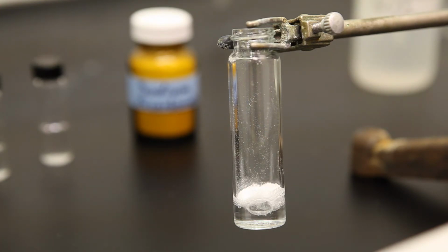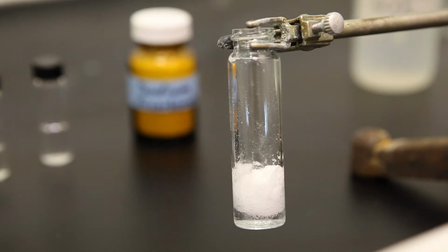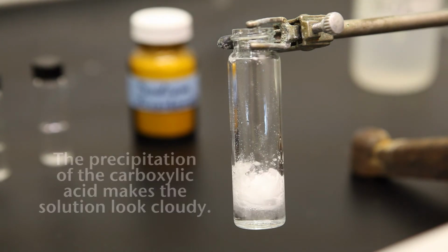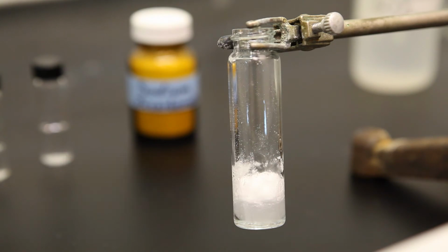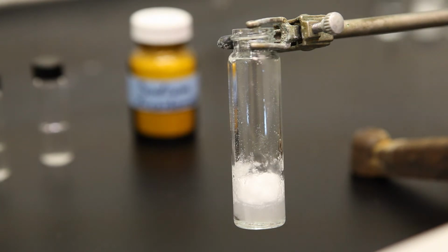Upon addition of hydrochloric acid, we find that the carboxylic group falls out of solution. But it can easily be neutralized again by using sodium hydroxide solution.